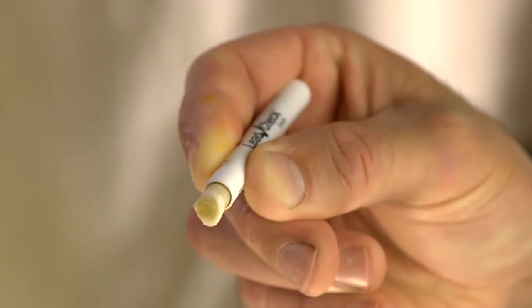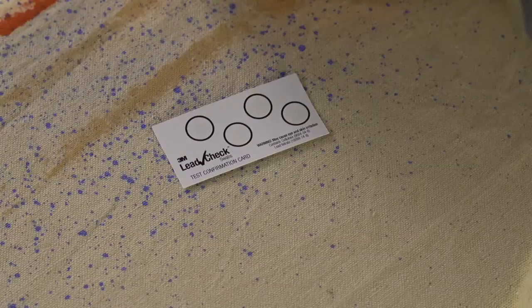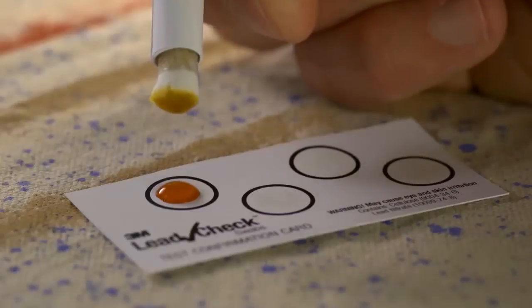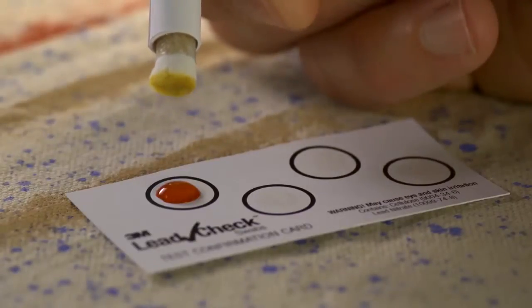If no pink or red color develops, immediately confirm the negative result by squeezing a drop of the 3M LeadCheck reagent liquid onto one of the test confirmation cards.